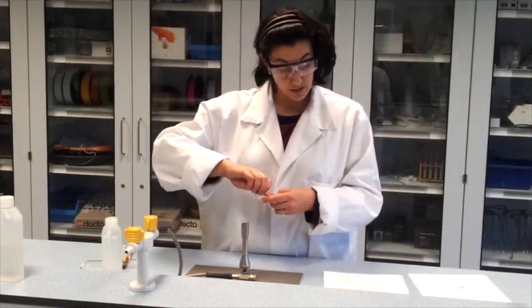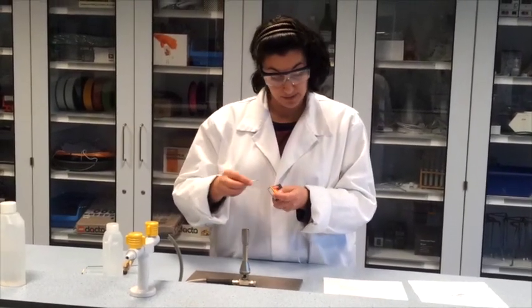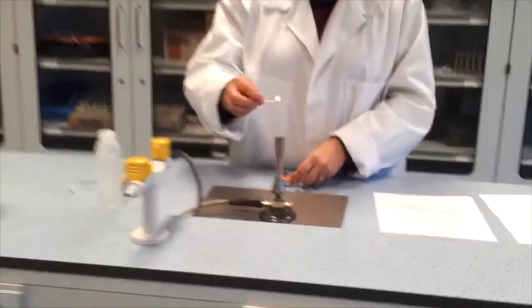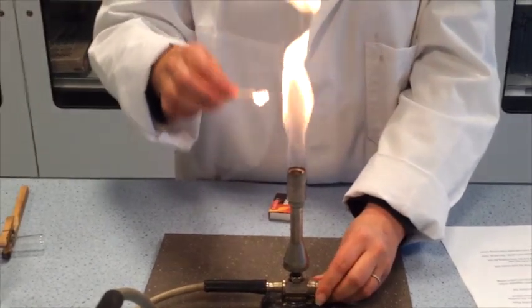Light a match. Hold it about three centimeters above the chimney. And quickly open the gas supply. And there is your flame.